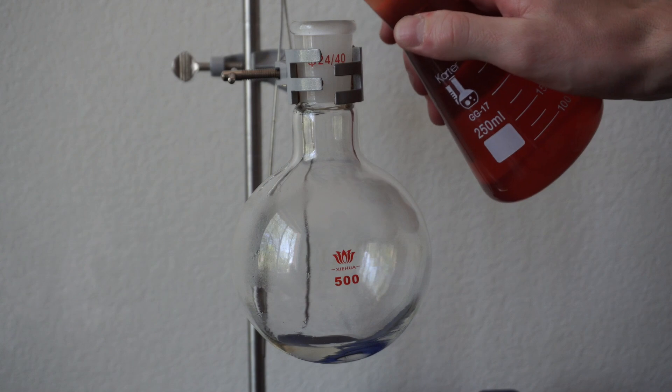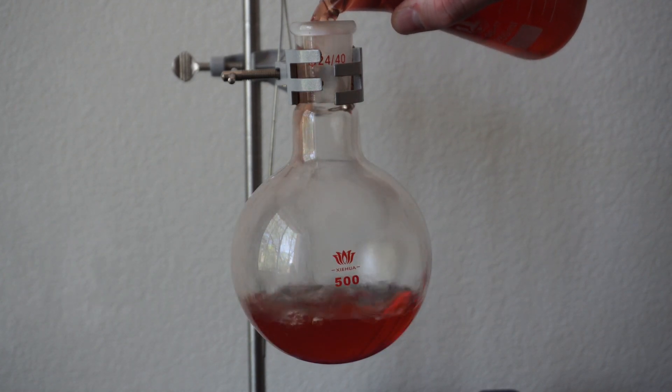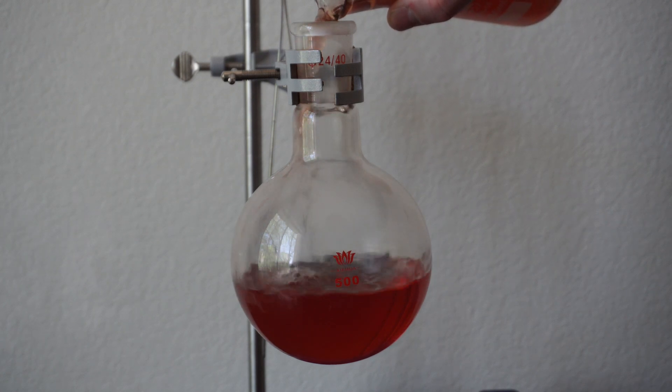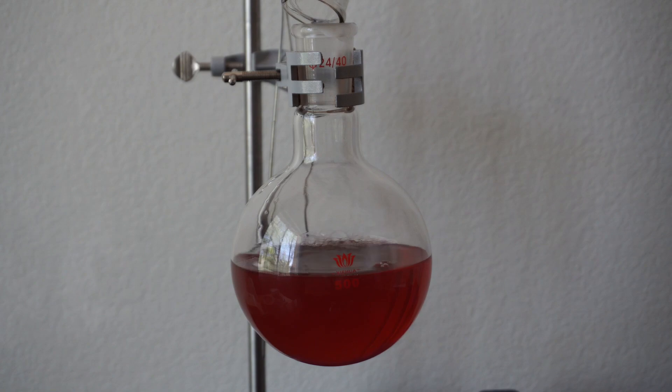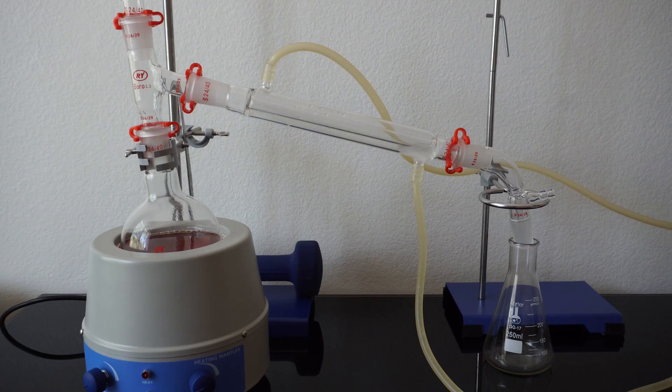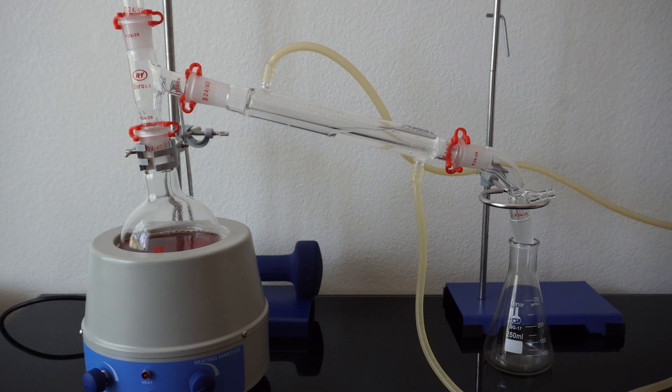The next day, I decided to distill the deeper smells first, since there was a larger amount of water that I would have to remove from it. This portion of the process took about two and a half hours. We will pour the starting mixture of about 325 milliliters into the starting flask, fill the condenser, and turn on the heating mantle.